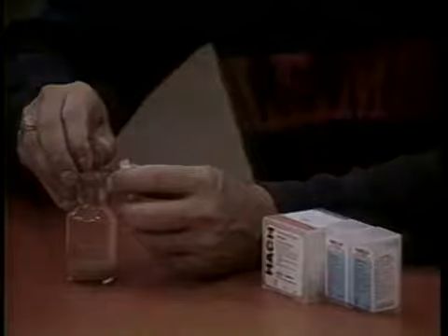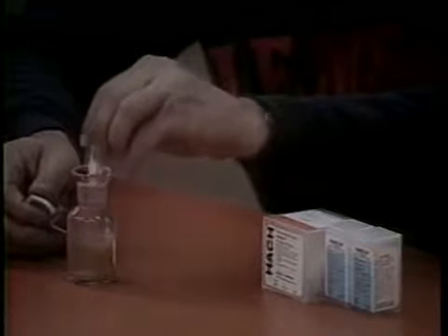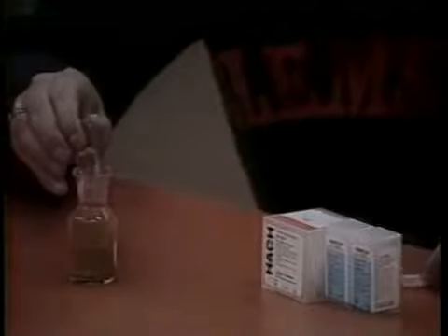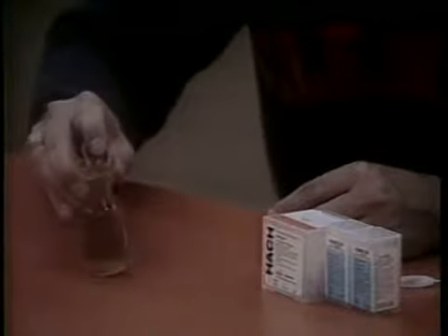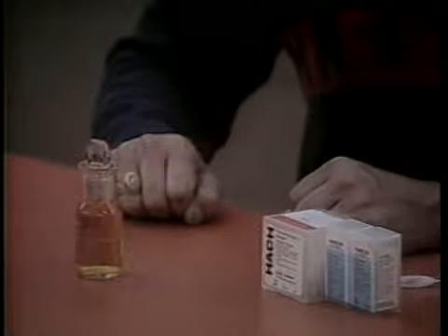Remove the stopper and add 1 dissolved oxygen 3 reagent powder pillow. Re-stopper and shake several seconds to mix. If air bubbles result, obtain a new sample and start over. After shaking, the flock will dissolve and a yellow color will develop if oxygen is present. This is now referred to as a prepared sample.